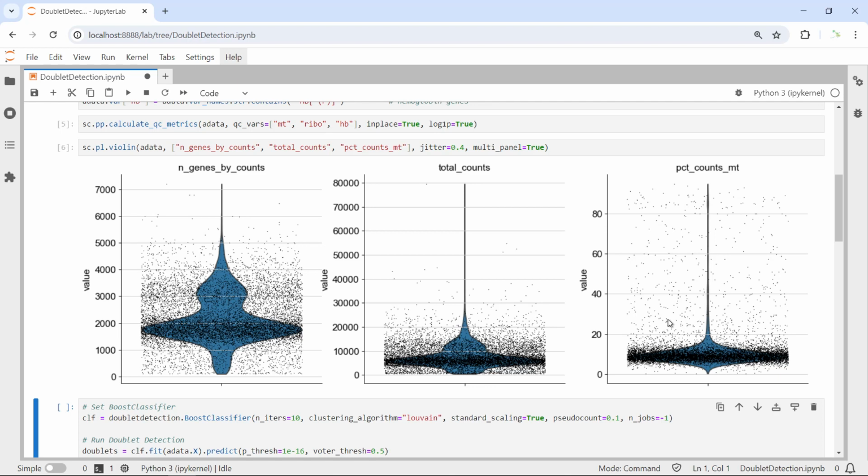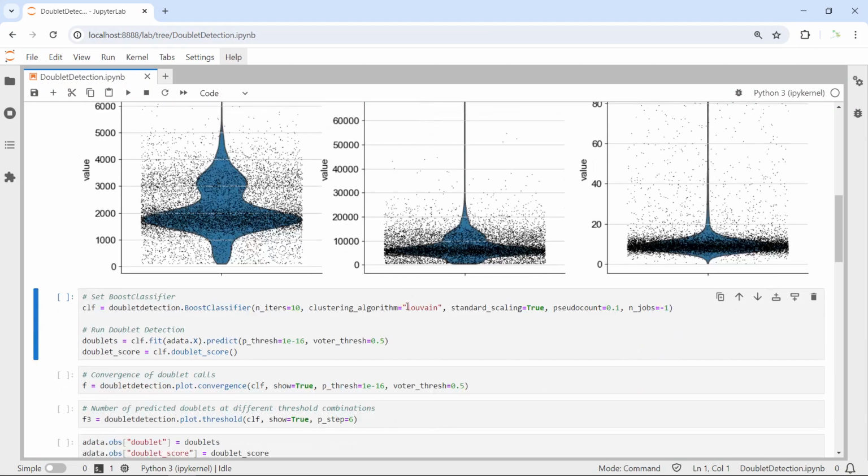So normally in this step, we will subset the data, just keep the cells that are in the violin shape region. Because today I'm going to demonstrate the doublet find function. Normally the doublet has high n genes by count and also high total count. So we are not going to subset the data now. We will go to the third step of quality control, doublet find, without subsetting the data by quality control metrics. In this way, we can more clearly see the doublets in the dataset.